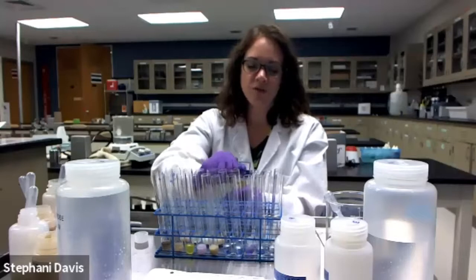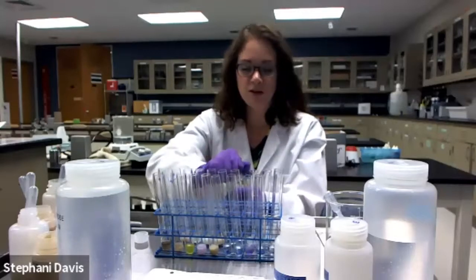So after I get the Benedict solution added, I'm going to go ahead and heat up those tubes. That test actually requires heating up the reagent for 5 minutes. Sometimes you can see the color change much quicker than that, depending on how high the amount of monosaccharides is.